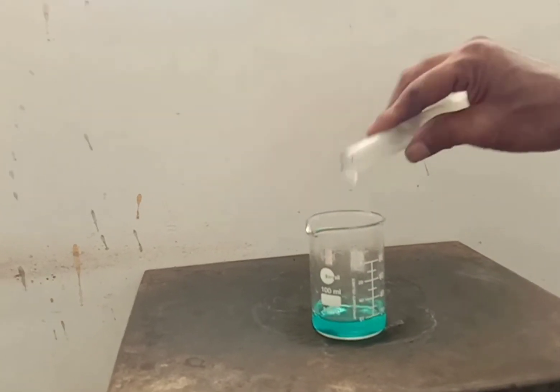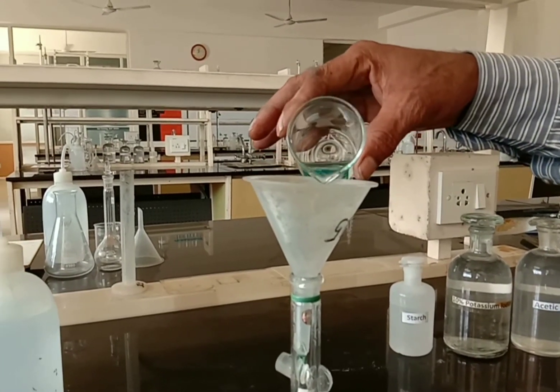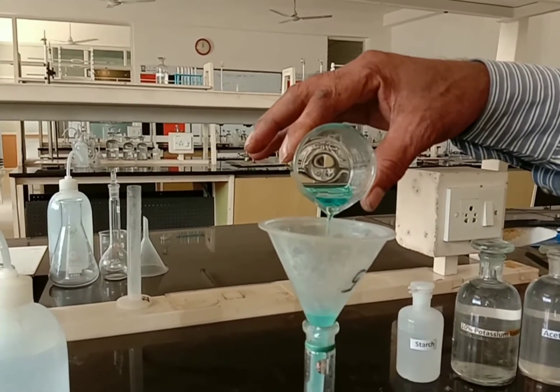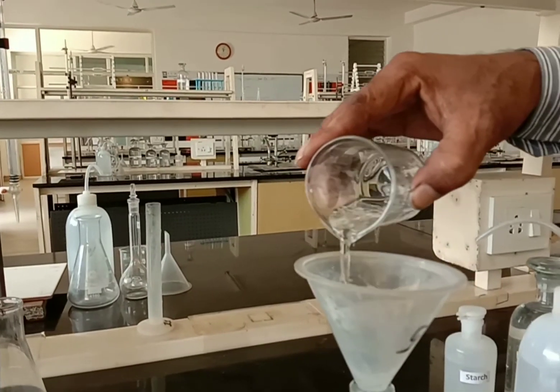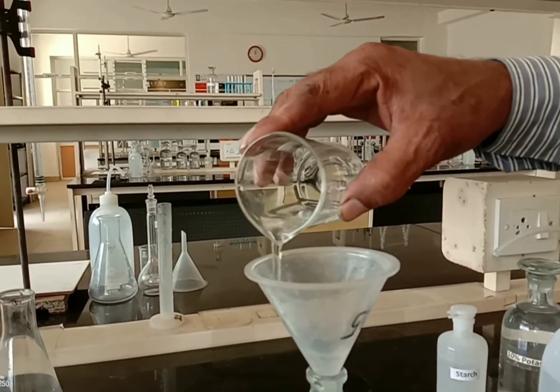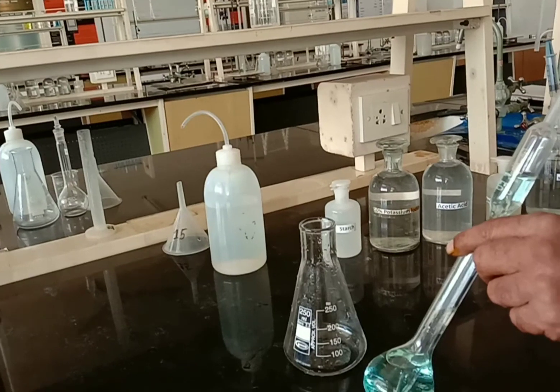Dilute the solution and transfer it into a standard flask to prepare a standard solution. Mix the solution well for uniform concentration. Fill the burette with standard sodium thiosulfate solution.